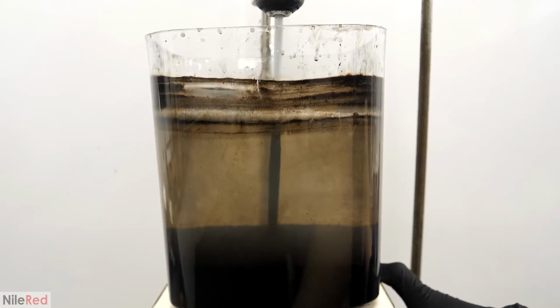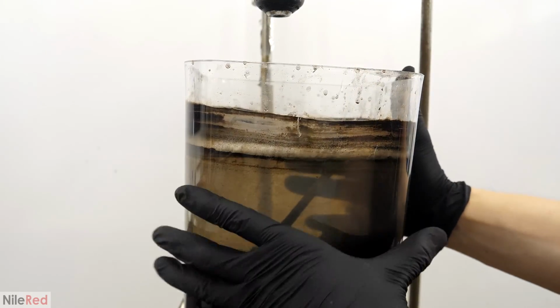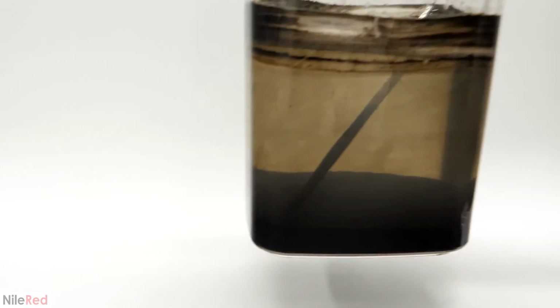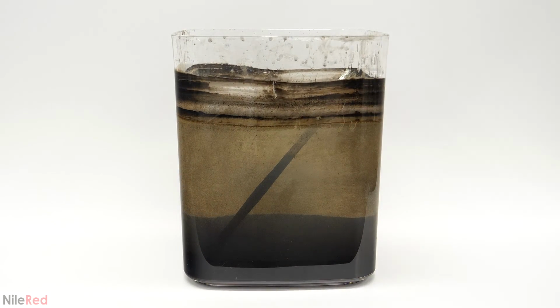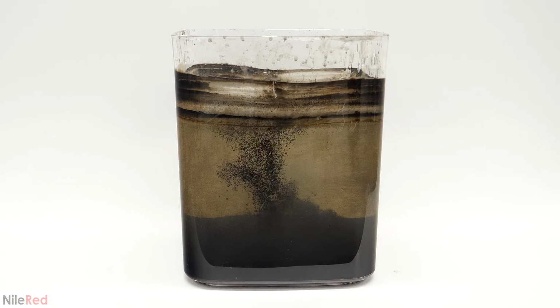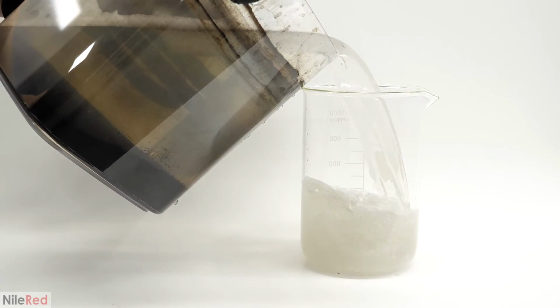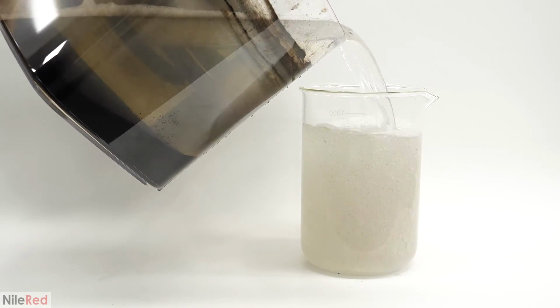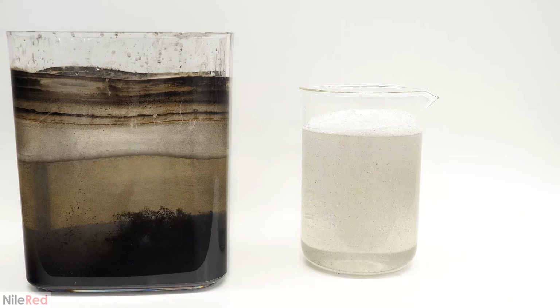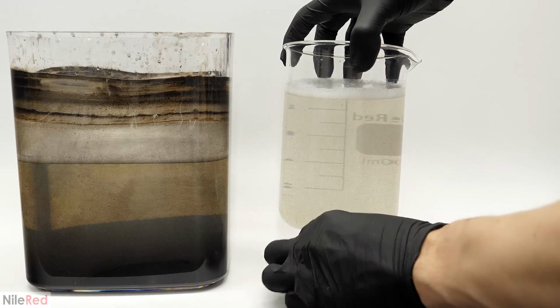To do this, it was actually quite easy, and all I needed was a magnet, distilled water, and some rubbing alcohol. The first step was to get rid of all that extra water, so into a beaker, I dumped off as much as I could. Then using a magnet, I pulled out most of the particles.